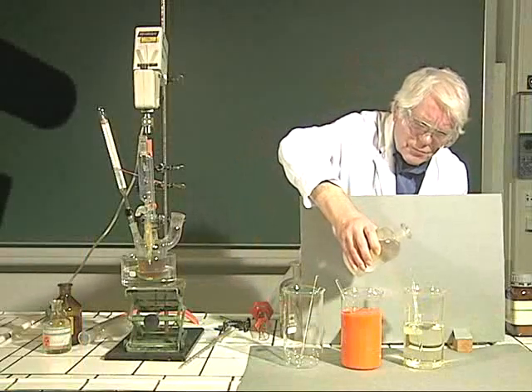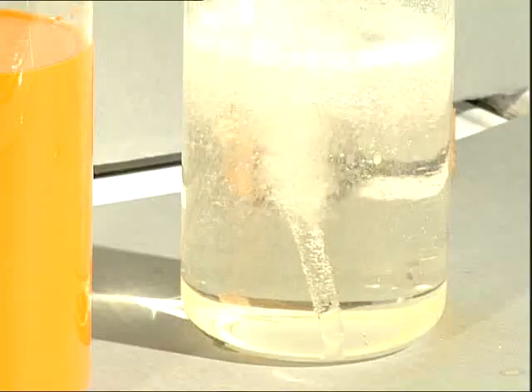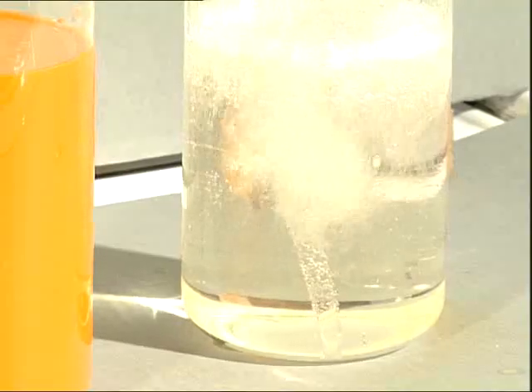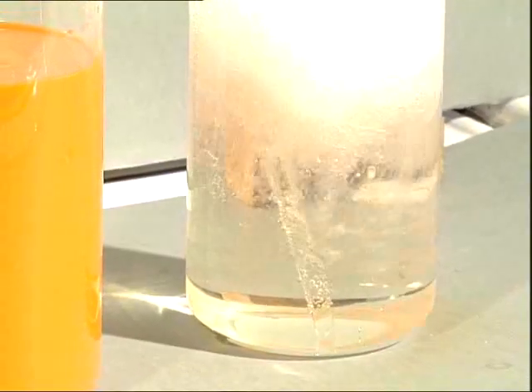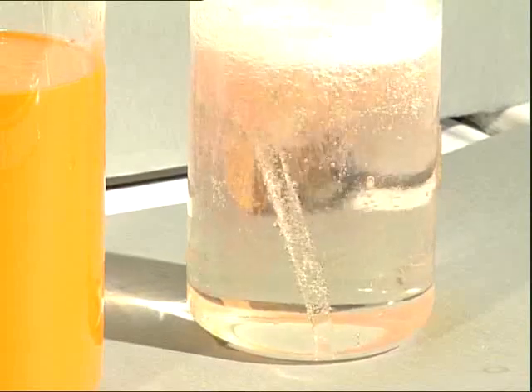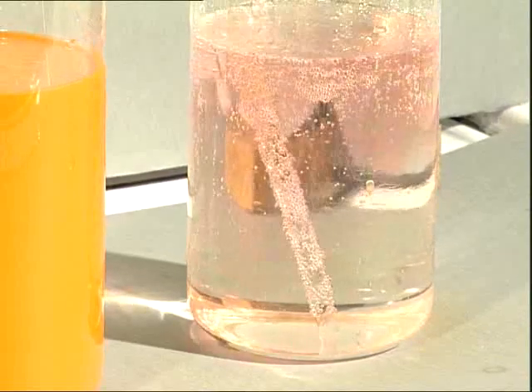However, the dye precipitates from the acidic medium only after neutralizing with sodium carbonate and salting out with, for instance, sodium chloride.